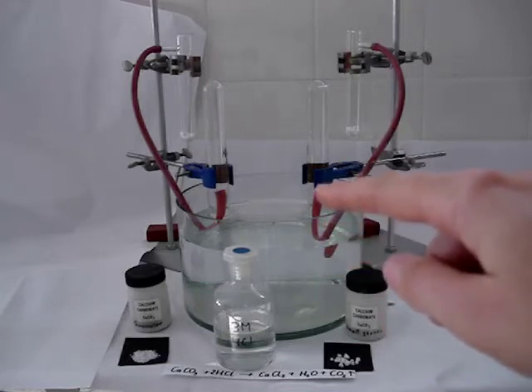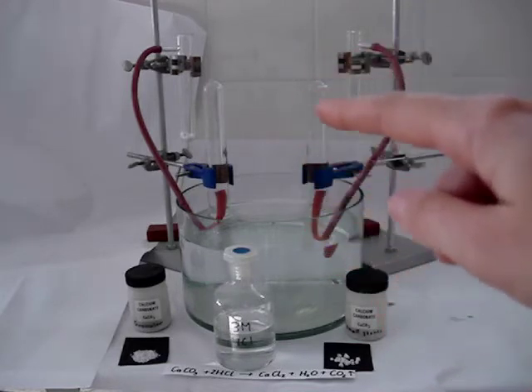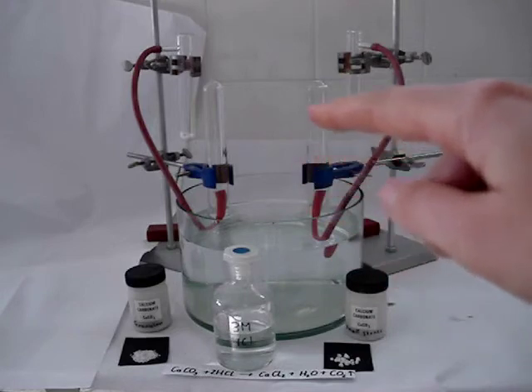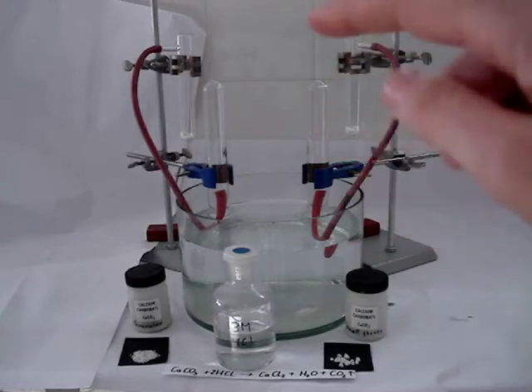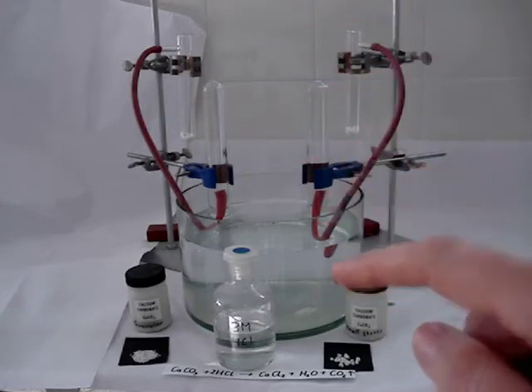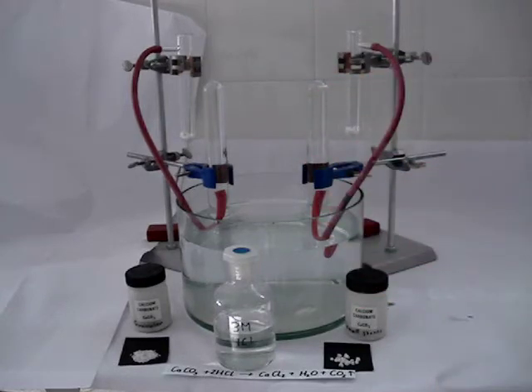Here you see that we have an inverted test tube filled with water. The gas is going to bubble up, displacing the water downwards. We call this the downward displacement of water. We will compare how much gas gathers in each case in a certain time.